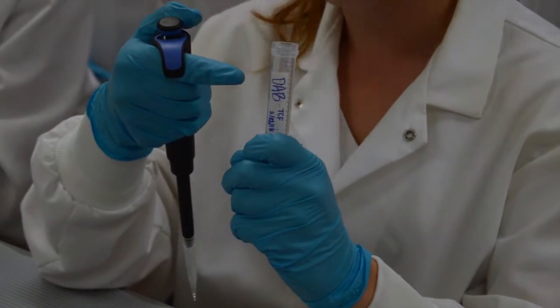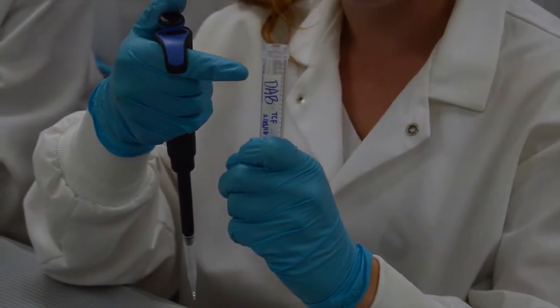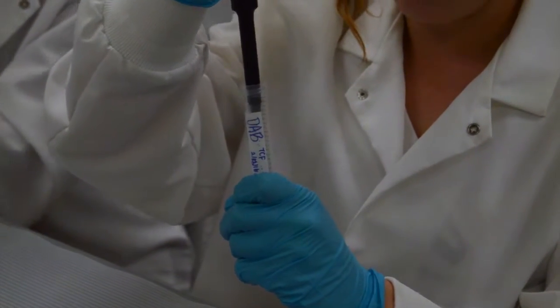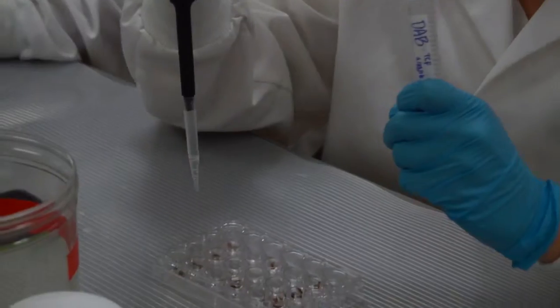Finally, DAB. This chemical, which is a mutagen to our cells, so extra precaution must be taken, causes a color change that allows us to visualize the protein.